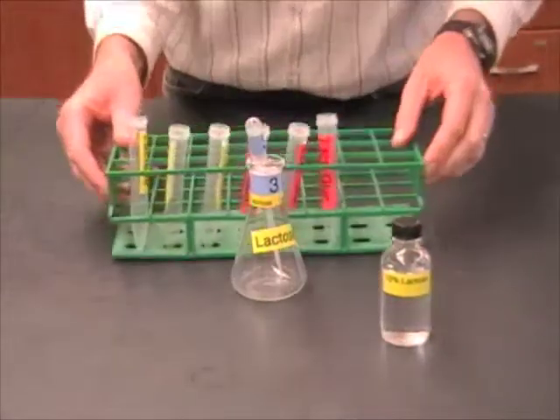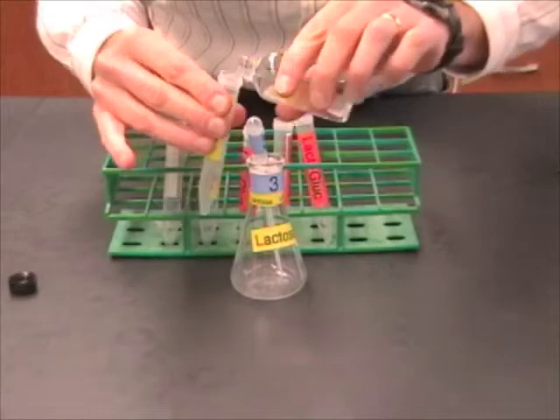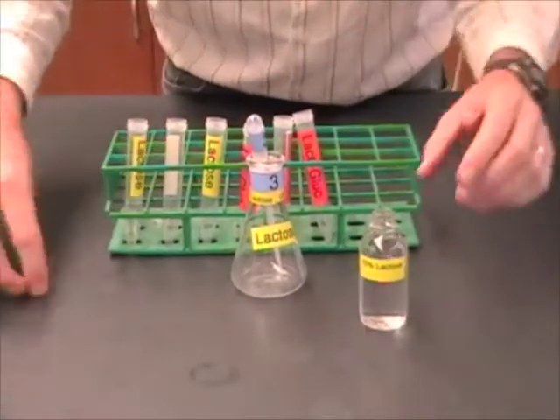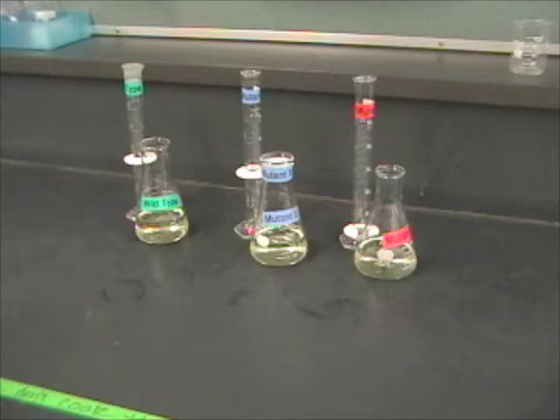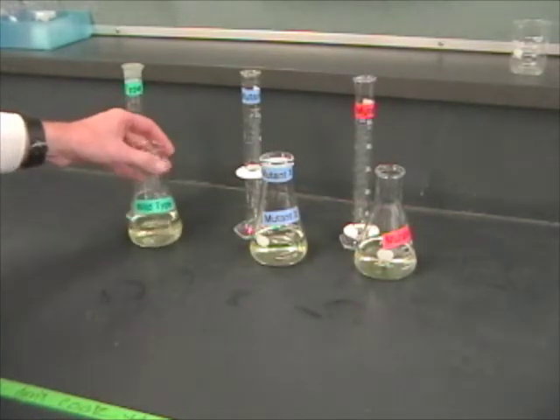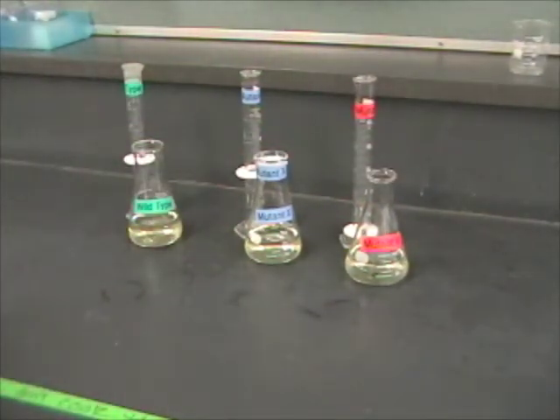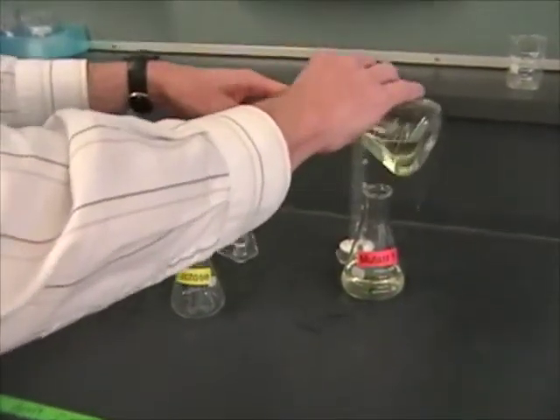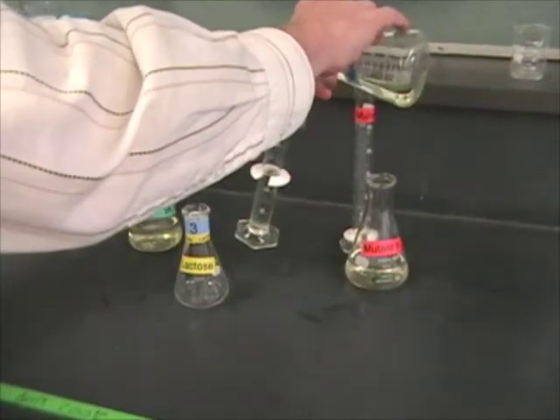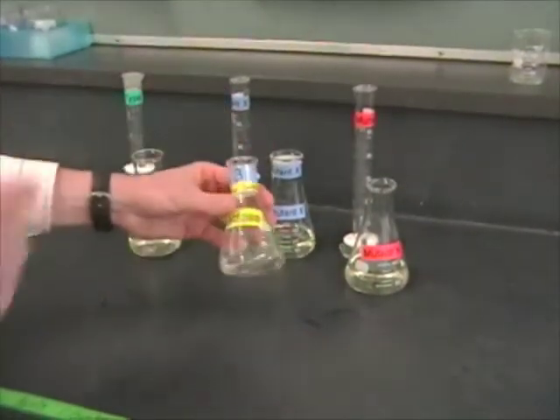Well, I can see that I need to add lactose to my flask. So, I'm going to get one of these color-coded tubes. And, I'm going to measure out three mils of lactose. And, then I'm going to wait on that because everybody has to be ready to go before you add the sugars. Now, over at the side of the lab are the different strains of bacteria. There's wild type, mutant X, and mutant Y. Now, the mutants, they have some change at the DNA level that affects the expression of the beta-galactosidase gene. Now, I have sample number three for my table, and that means that I'm going to need mutant X. And, so, I'm going to measure out 27 milliliters of mutant X, and then take this back to my table.